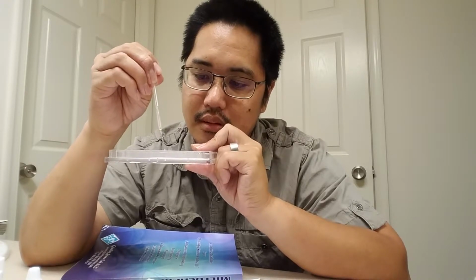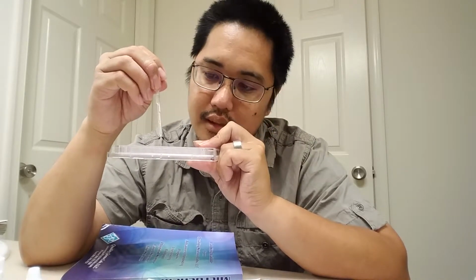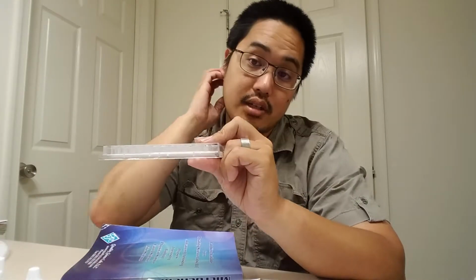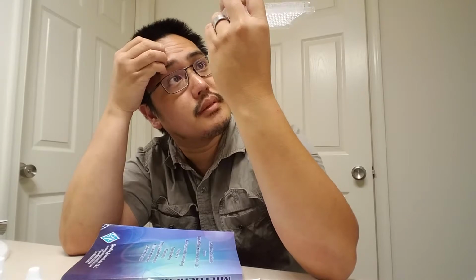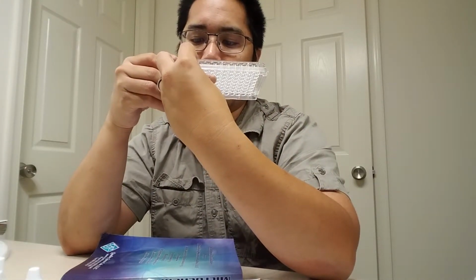1, 2, put the rest back in 6, mix it up, and then I'm going to take 2 drops out of well number 7. I'm just going to throw it away. 1, 2. I'm going to put the rest back in well number 7. So there, that should have been consistent all the way across the board. And if you look at it, which you can't see, but I can see it, they're all pretty nicely at the same height.